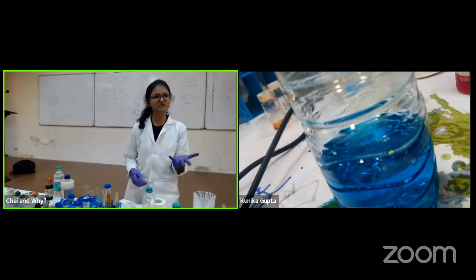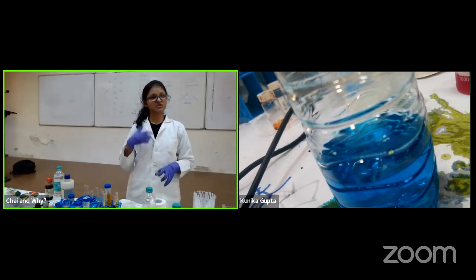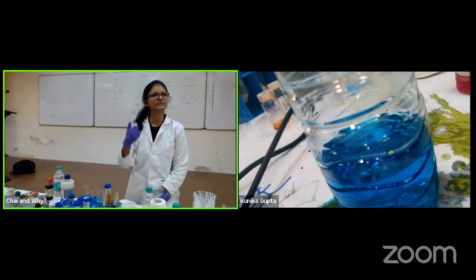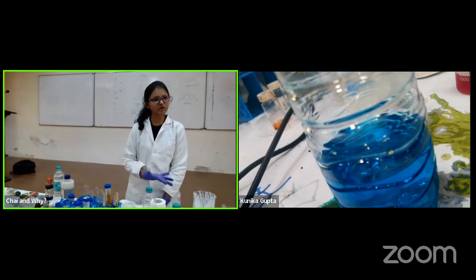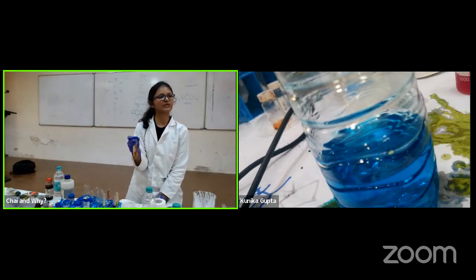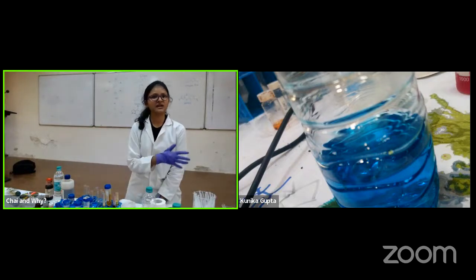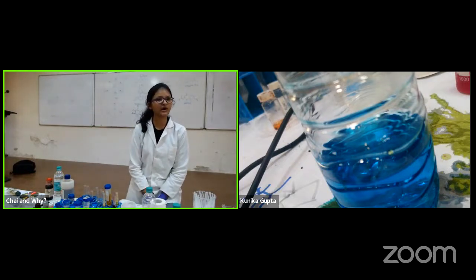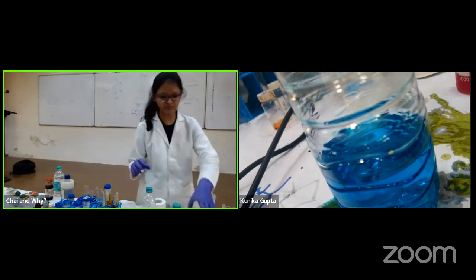There will be a reduction going on by the glucose, and an oxidation which will happen because of the presence of the oxygen. So if there's an excess amount of reducing agent, which is the glucose added to it, it will take some time to happen. Eventually I'm very confident that this will happen too, with some amount of oxygen added to it. Okay. So that again tells you that we have to add things precisely. It's not that you can randomly dump things.